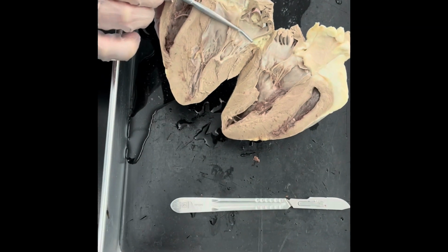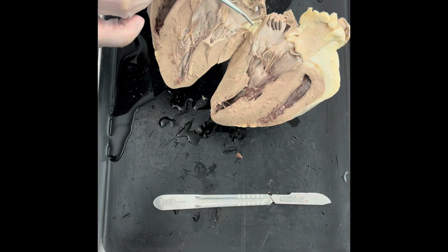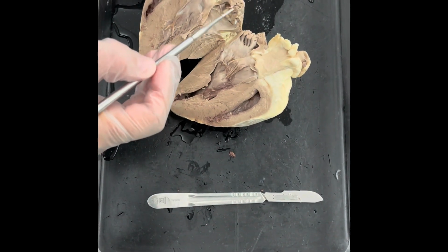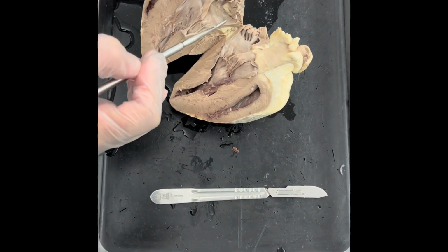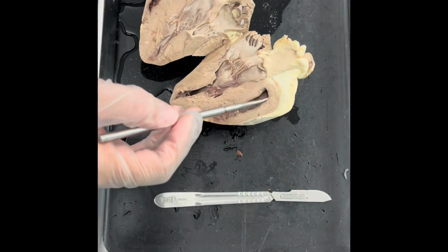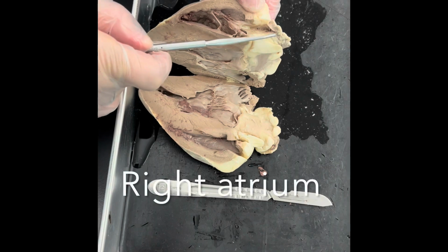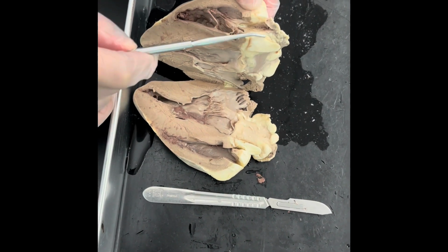Remember that from here down, these are ventricles. From this point superiorly, there are going to be the atria. So this is one of the atria, in this case, the left atrium. You see the other half right here. And then on the right side, that's the right atrium right there.